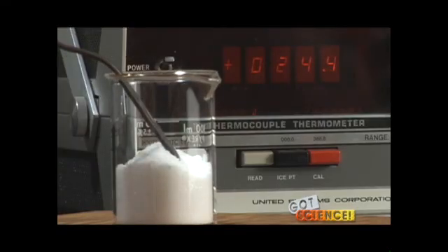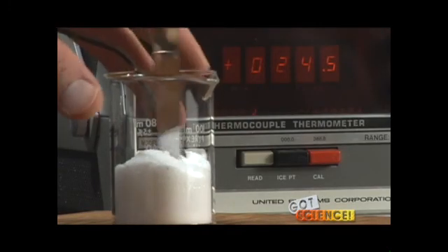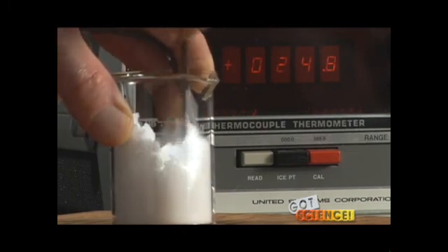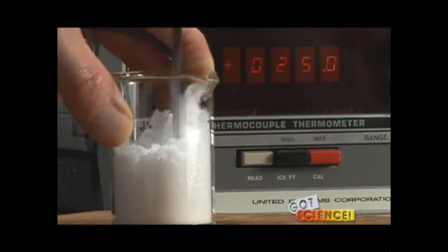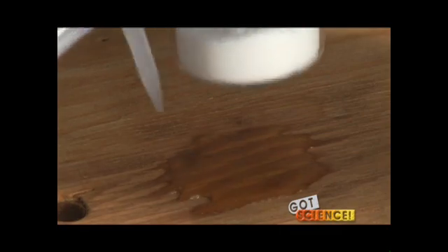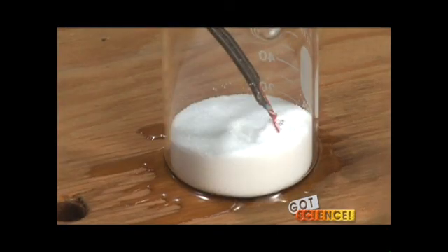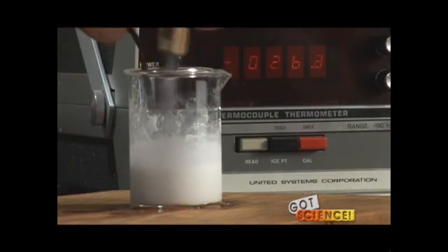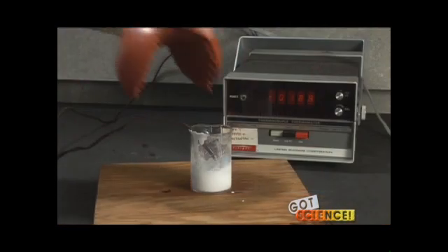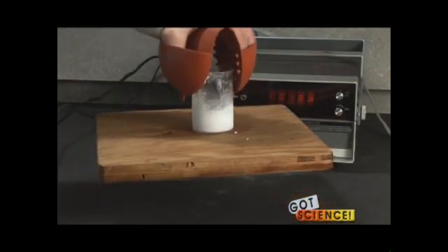During the investigation, you'll mix the chemicals together in a beaker. The reaction will produce water and create a slurry. The drop in temperature will begin quickly, and here again, you'll use a thermocouple to monitor the results. You and your students will apply a few drops of water to a piece of ordinary wood, then place the beaker on top. The temperature should continue to drop as low as minus 28 degrees Celsius, and after two or three minutes, the beaker should freeze solidly to the wood.